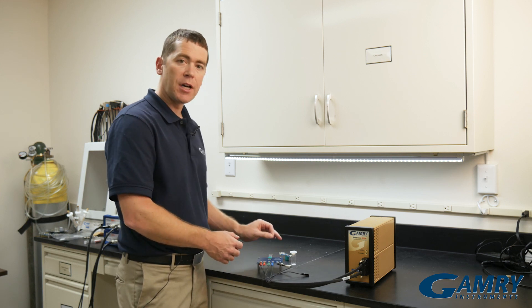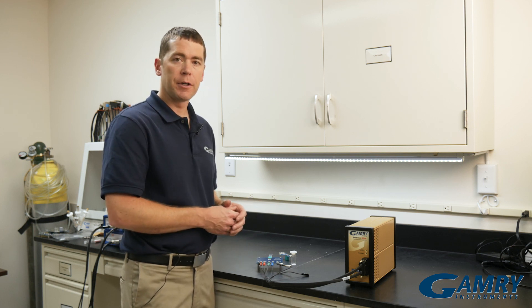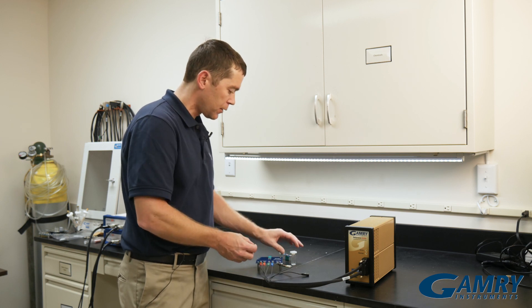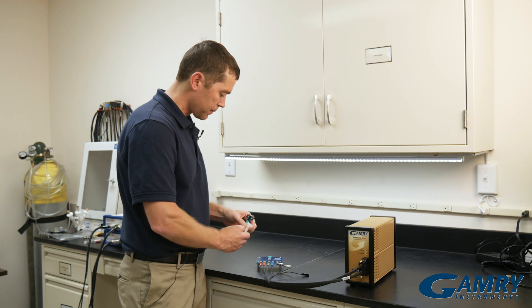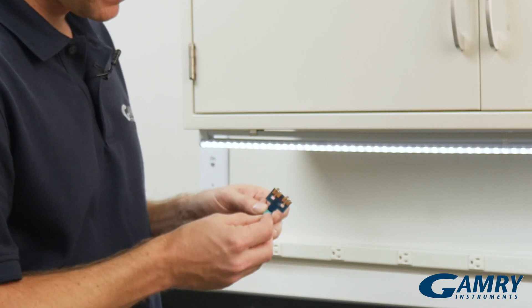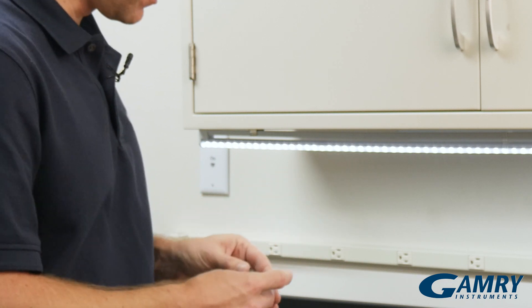We lay this flat and we can place a drop of solution on the screen printed electrode and run whatever experiments we need to. If you need to run an experiment where you have to have more sample volume, you can use our screen printed electrode holder that fits inside a cuvette. We take our smaller holder and simply attach our screen printed electrode.